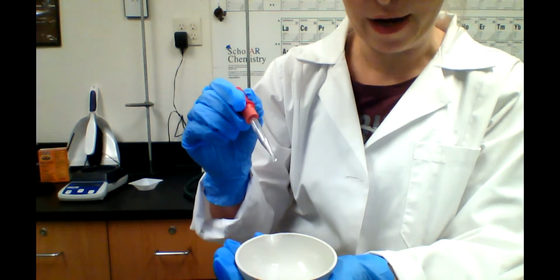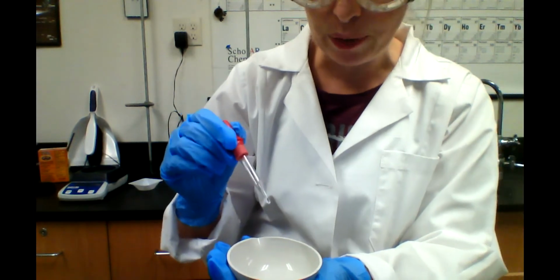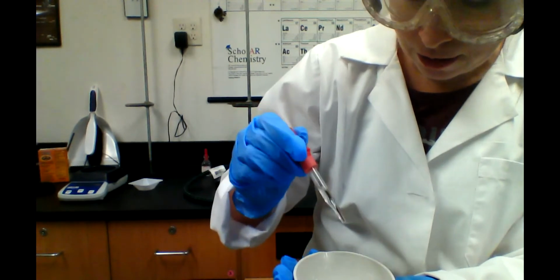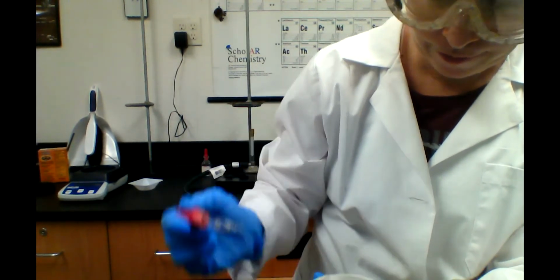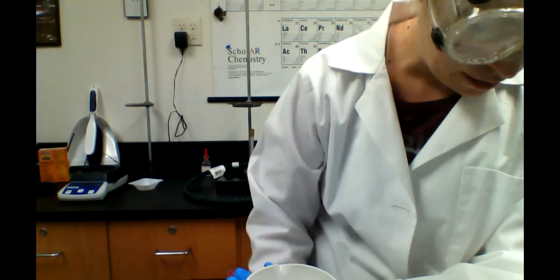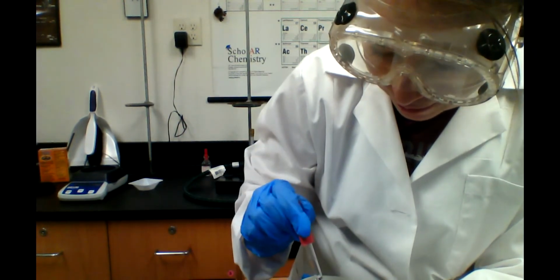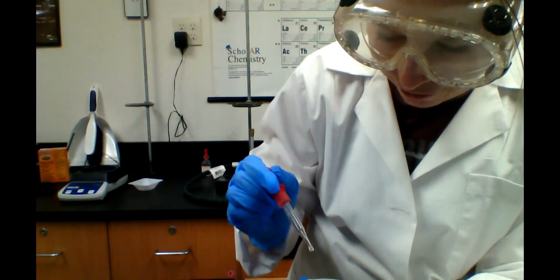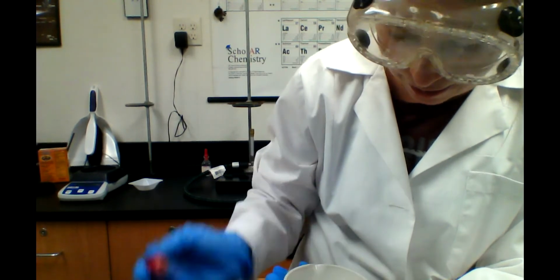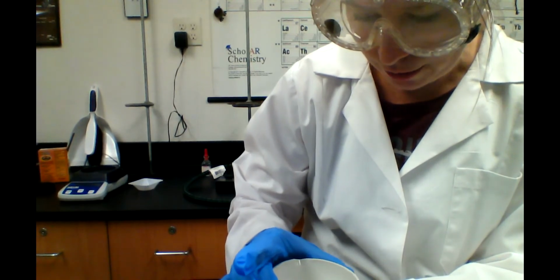As I swirl it around, the acid can get to more parts of the baking soda, and I can see there's like a pea-sized amount of baking soda there in the center, and I have a lot of water forming. The carbon dioxide is leaving, the water is forming, and I'm down to maybe like the tip of a pencil. I can see a little tiny bit of that baking soda there, and it's still reacting, so I'm going to give it a minute. Give it a little swirl.